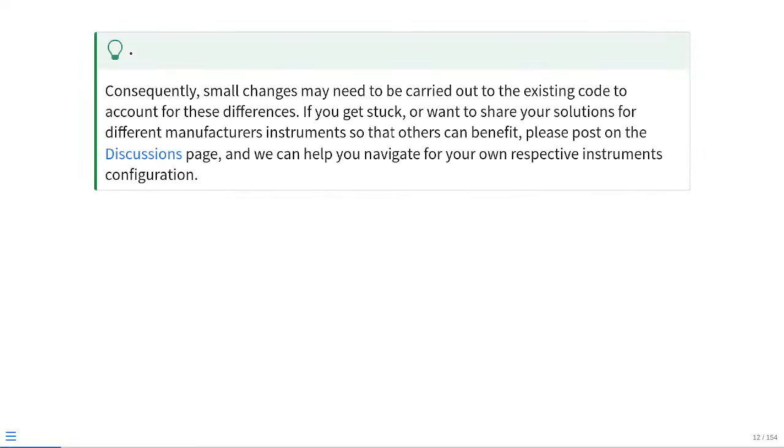Consequently, if you do try your own data set, there may be small changes needed to the existing code to account for these differences.